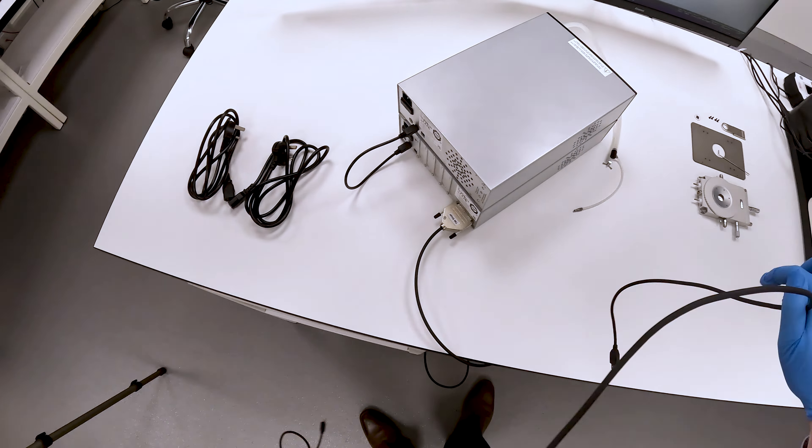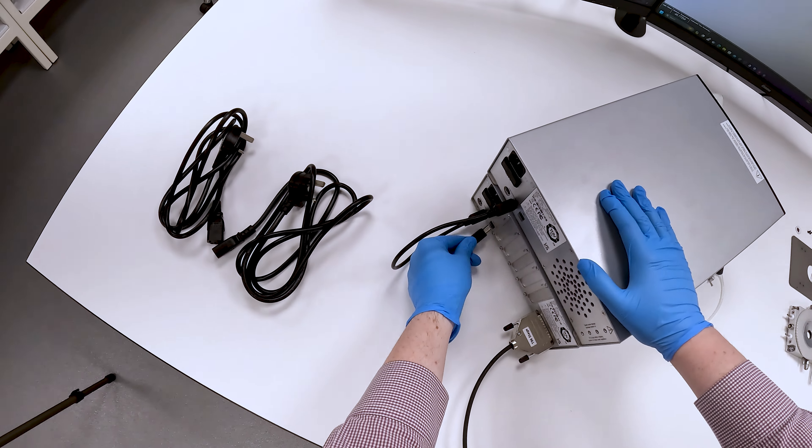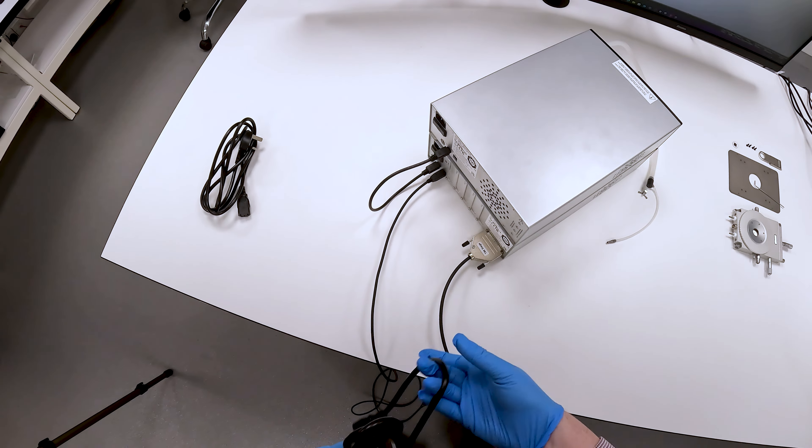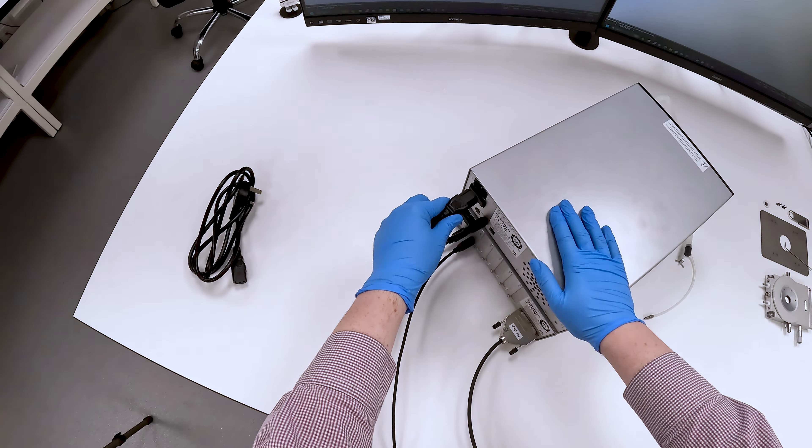The USB cable for PC control of the system which goes into the T96, and the power cables for both controllers.